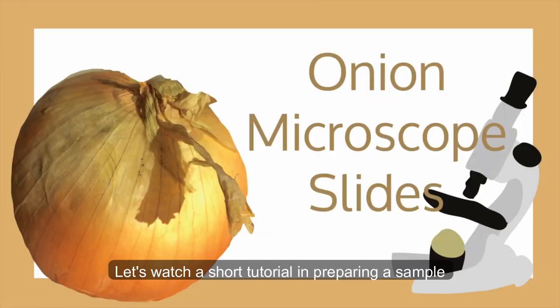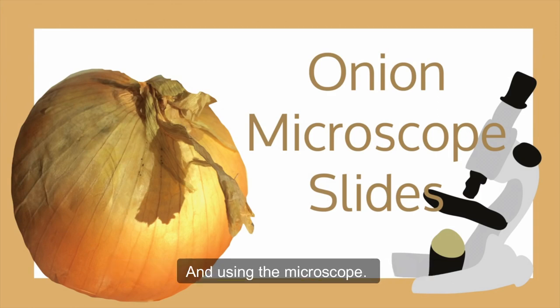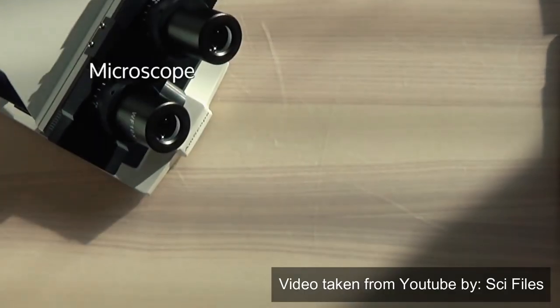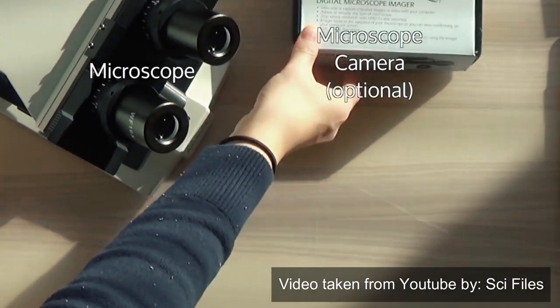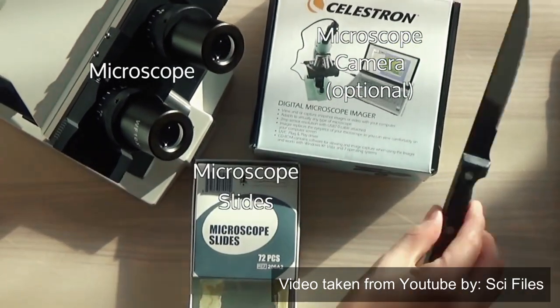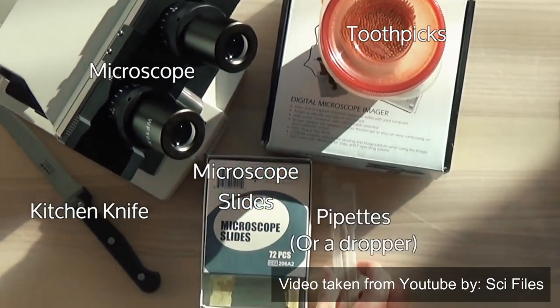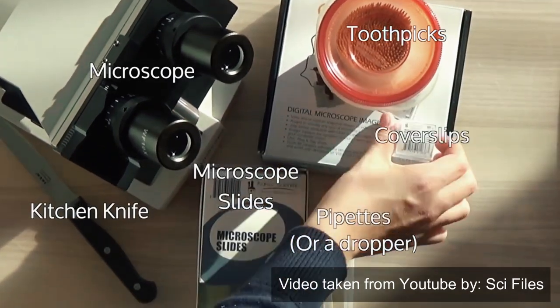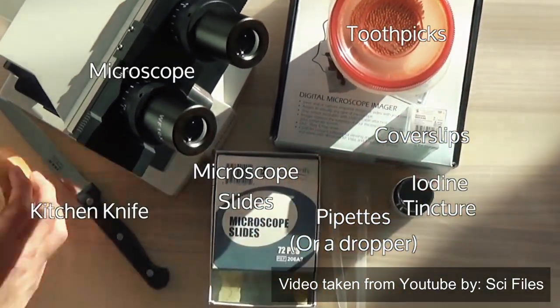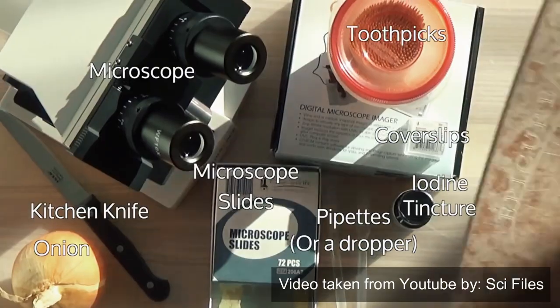This is a short tutorial on preparing a sample and using the microscope. You will need: a microscope, a microscope camera, microscope slides, a kitchen knife, toothpicks, pipettes, cover slips, iodine tincture, an onion, and a cutting board.